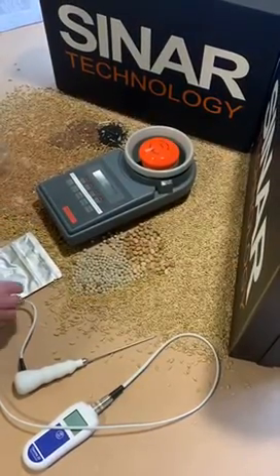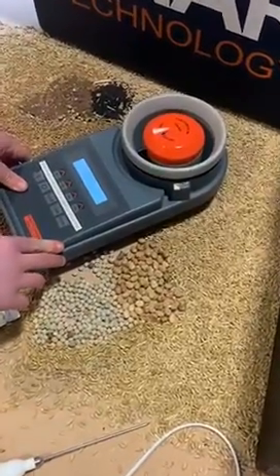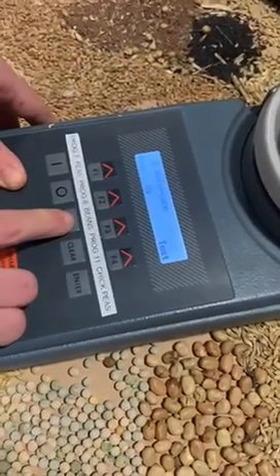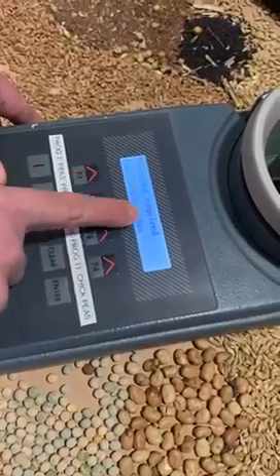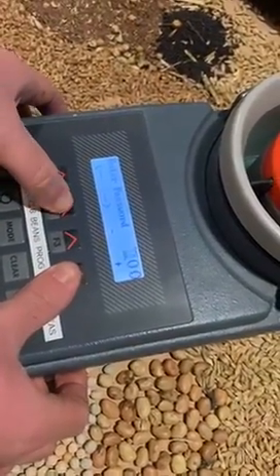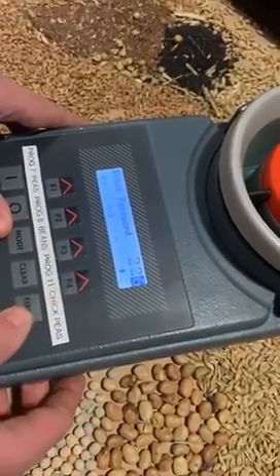To start with, the machine needs to be turned on. Once on, by pressing mode, we can cycle through the menus and we get to the password. The password for all the Beam Pros is 226 and then enter.